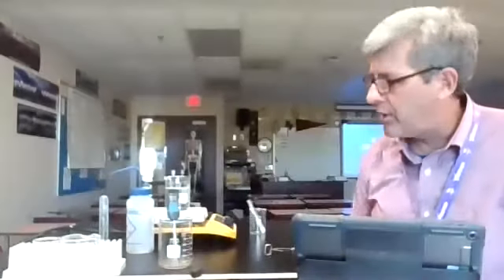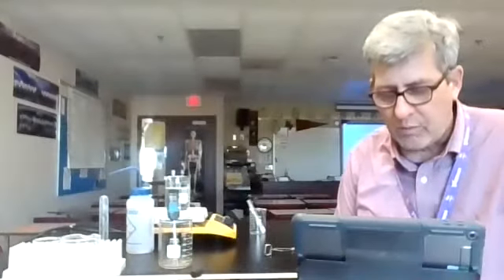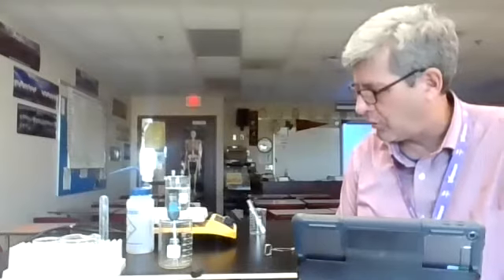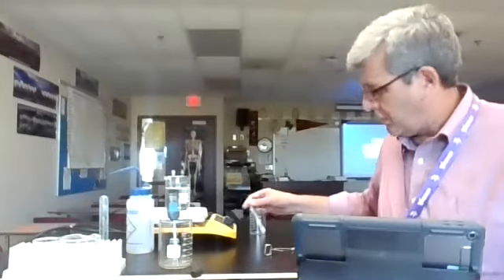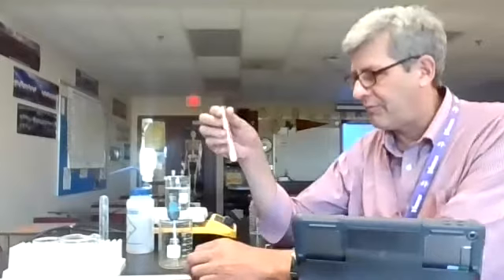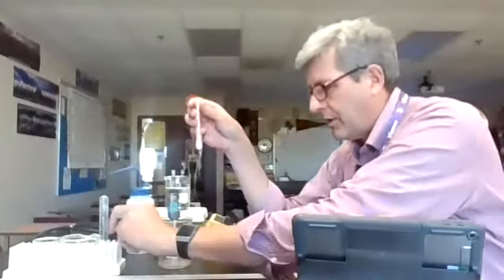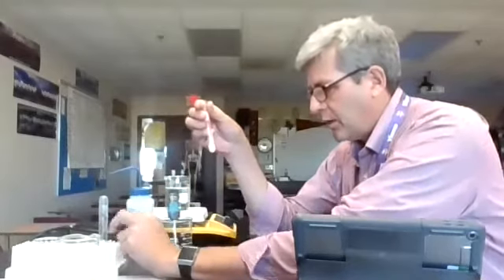Okay, guys, today we are going to do the lab dealing with the phase change of a pure substance. That pure substance is paradichlorobenzene that we're going to work with. So this is the paradichlorobenzene. It's moth flakes or moth balls. You would usually have this on here, but I took it off getting ready for the lab. It is in its solid state right now.